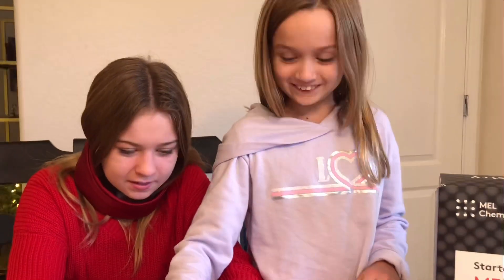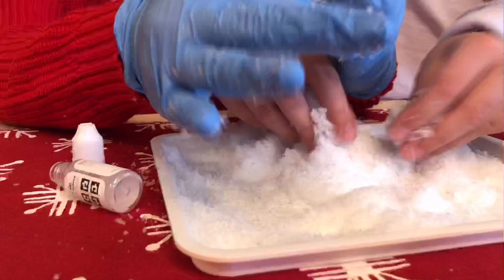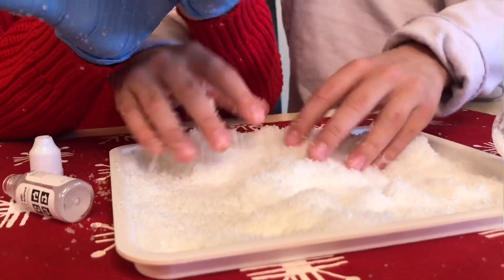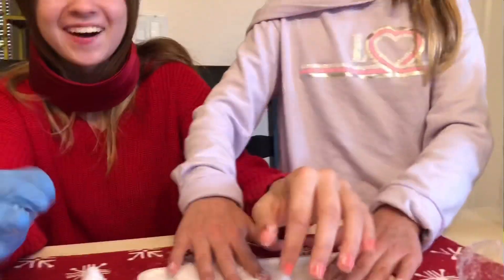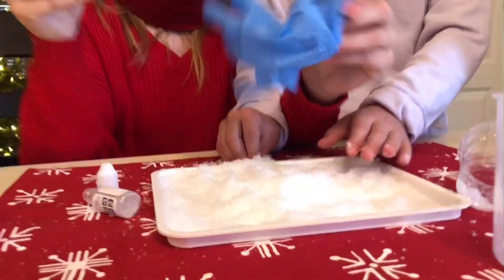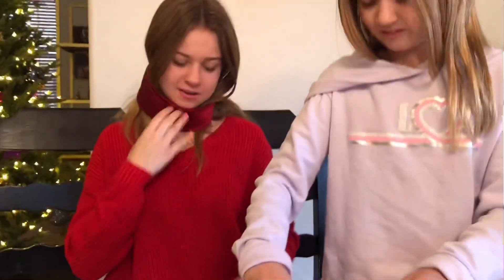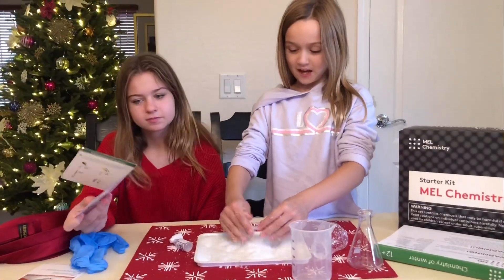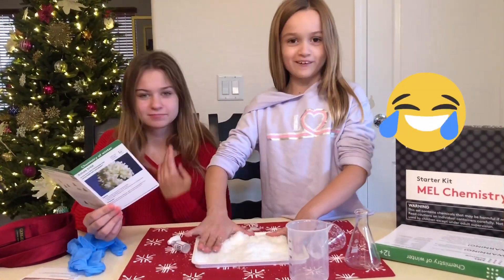Did you touch it? What does it feel like? It feels like... like corn. It does not feel like corn. If anyone's wanting to try this, I'll tell you it does not feel like corn. We've now made snow in Phoenix — not corn!